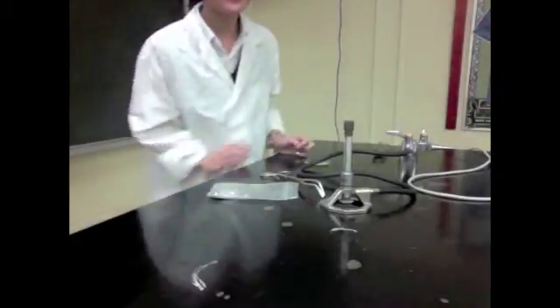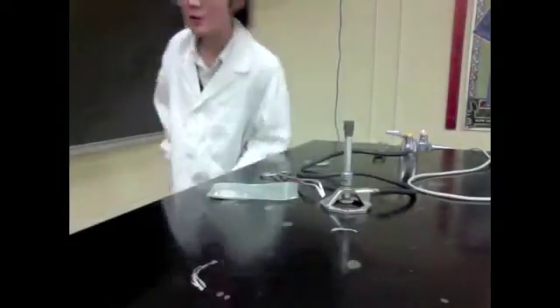Hi class, my name is Cindy. Today we're going to be doing the burning magnesium experiment. So the first thing you're going to need are safety goggles and your lab coat. Also, if you're a girl, tie your hair up like me so you don't want to get it all burnt.